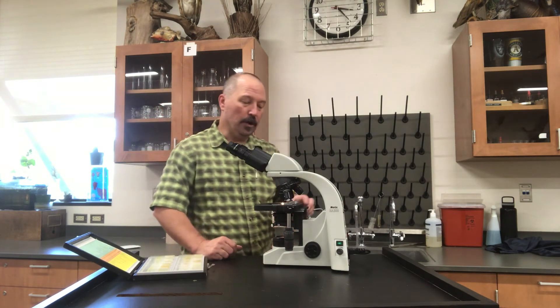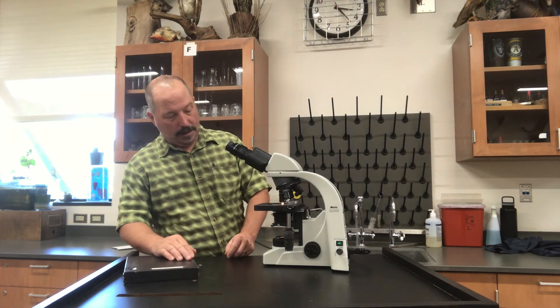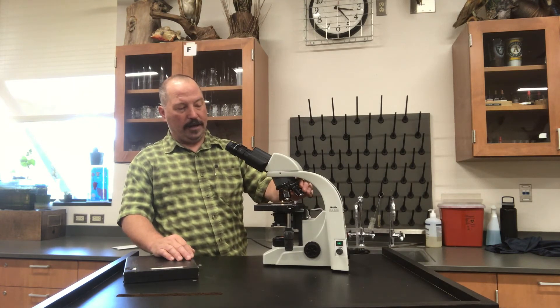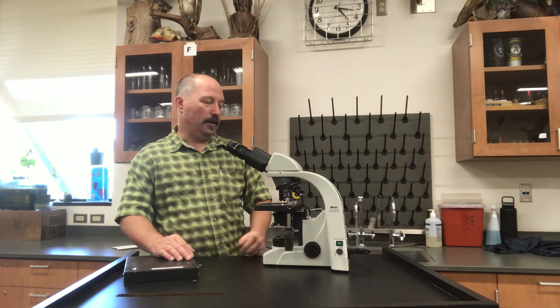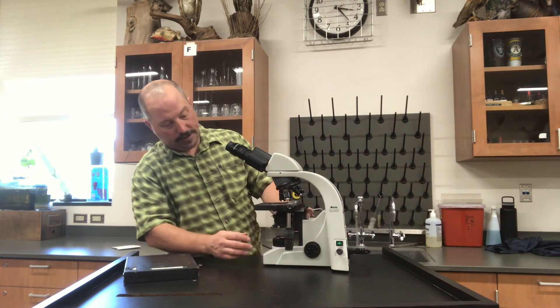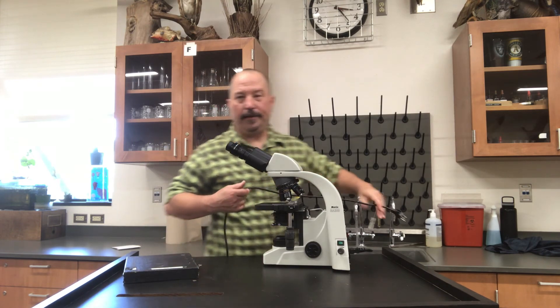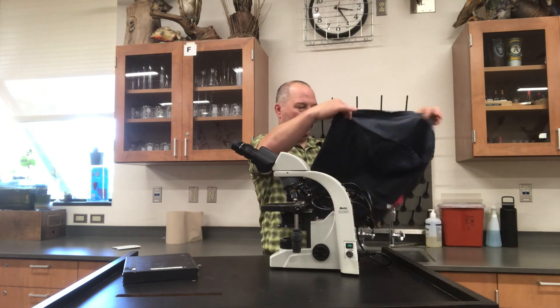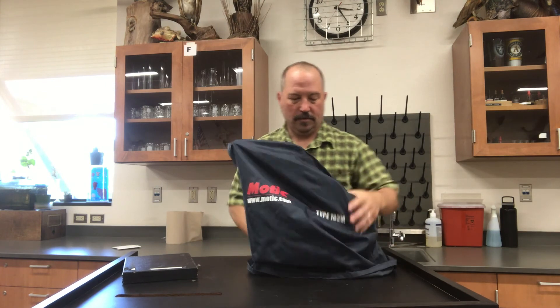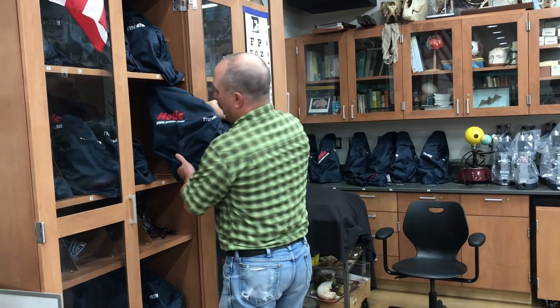To put everything away, you'll open up the stage clip, take the slide out, and put the slide back into the properly labeled part. Then you want to adjust the lenses back all the way to the smallest lens, which is the 4X. You'll also want to put the stage all the way up to the top and the condenser all the way to the top. Turn off the light and unplug it and coil it up. Put the dust cover back on. Hold the microscope by the handle with two hands and put it back in the cabinet. When you put the microscope back, make sure that the oculars are facing away from you and you have the handle facing you.